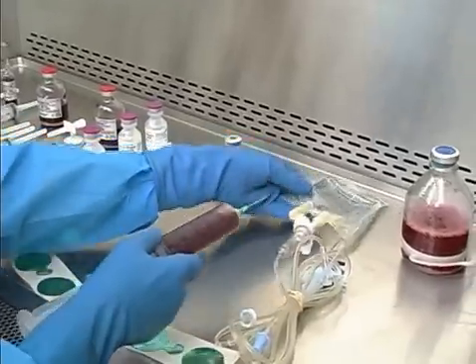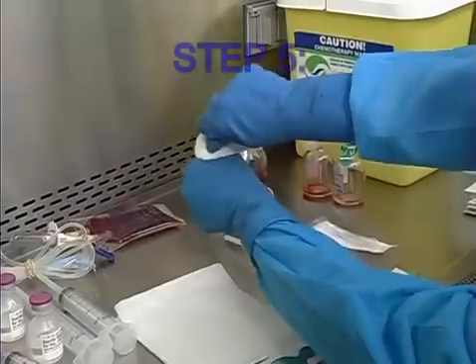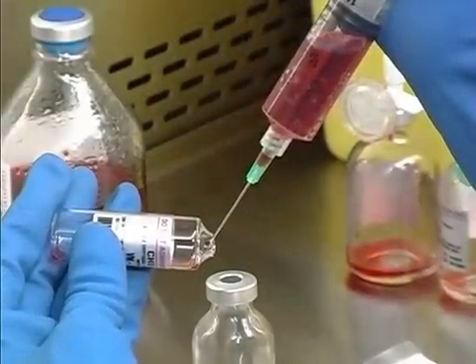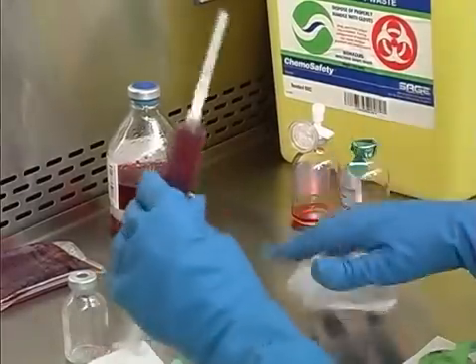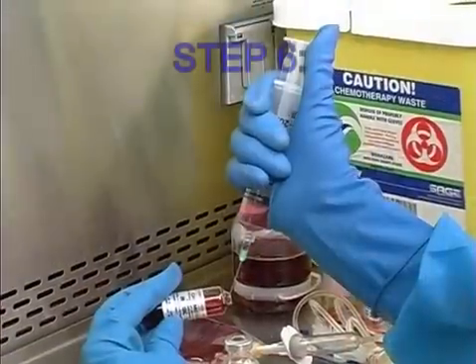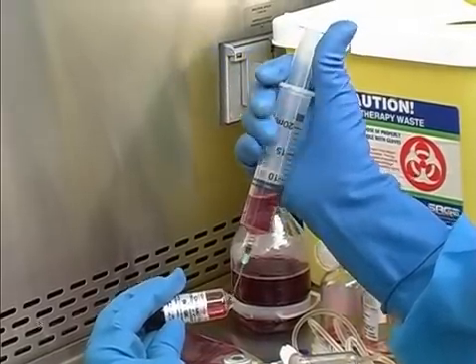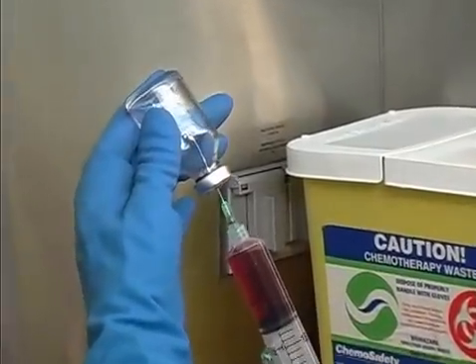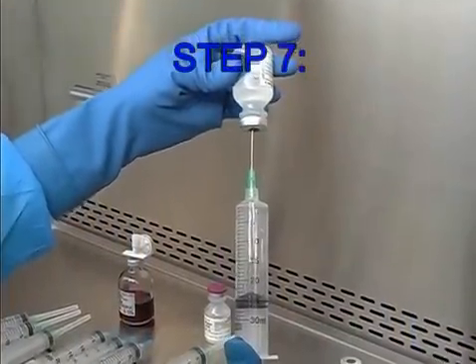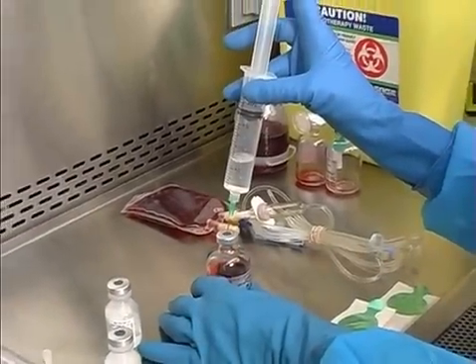Step 4: Without using a dispensing pin, remove 50 ml's of medium from the second VM 50 vial and transfer into the final container. Step 5: Transfer 10 ml's from one of the VM 10 AC ampules into the evacuated container. Make any final adjustments in an empty vial. Step 6 follows.